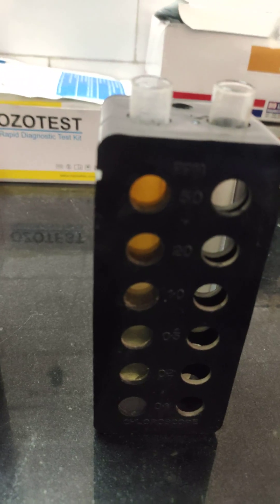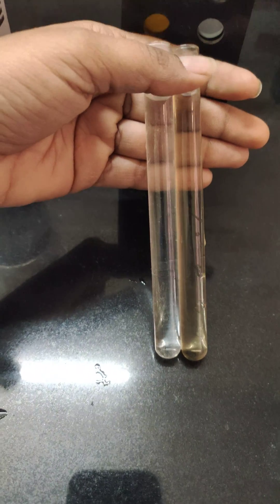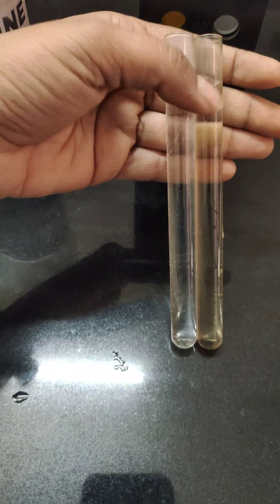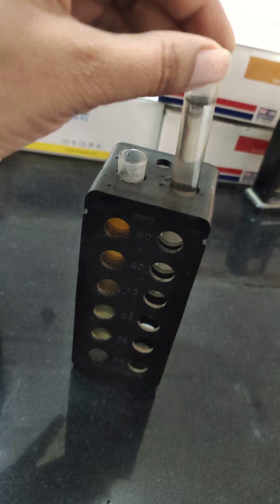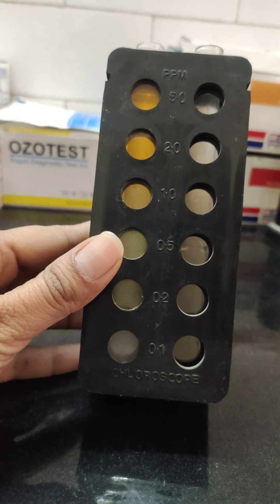Here you can see the result — the color difference between both tubes. The second tube contains the drinking water sample. We match the color against the chloroscope scale to get the residual chlorine reading.